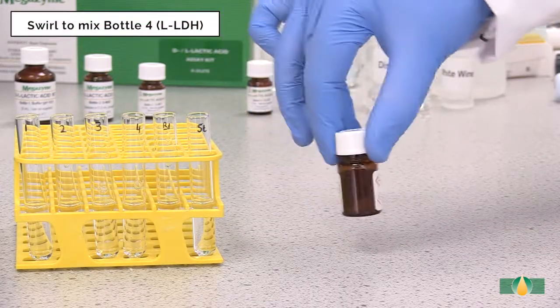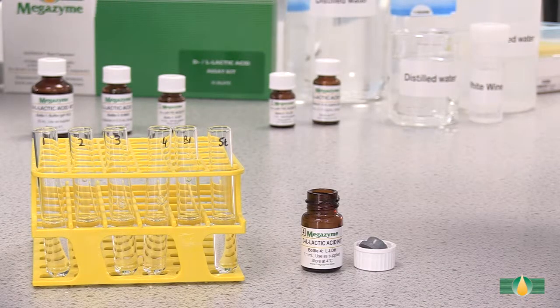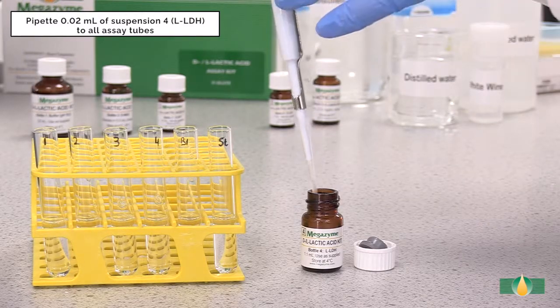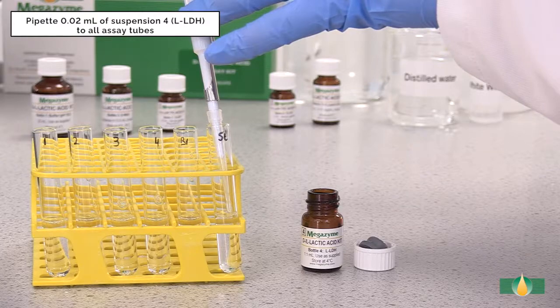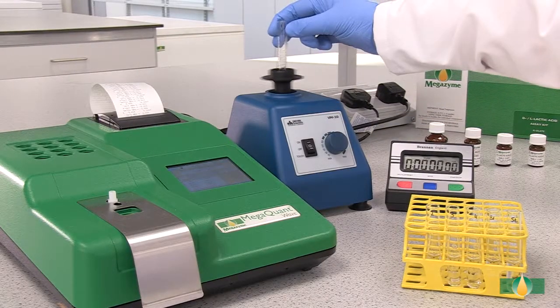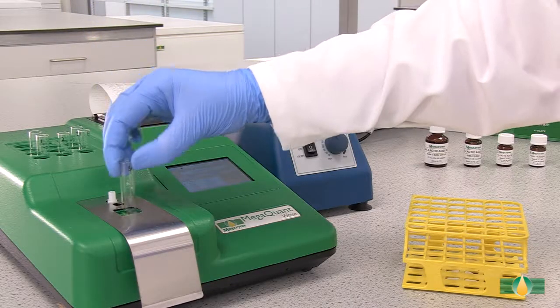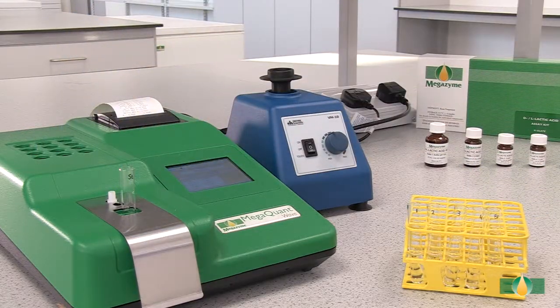Swirl to mix the contents of bottle 4 prior to dispensing. After recording the A2 absorbance value, pipette 20 microliters of the second trigger enzyme, L-lactate dehydrogenase, into all assay tubes. Mix the tubes thoroughly and incubate them at 37 degrees Celsius for 10 minutes to allow the reaction to go to completion. Record the absorbance reading A3 for all of the assay tubes. This absorbance reading completes the measurement of L-lactic acid.